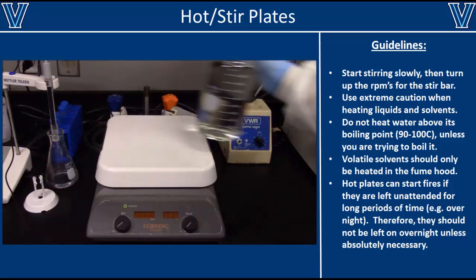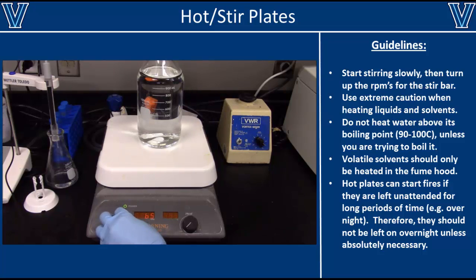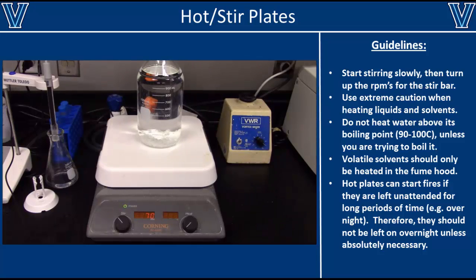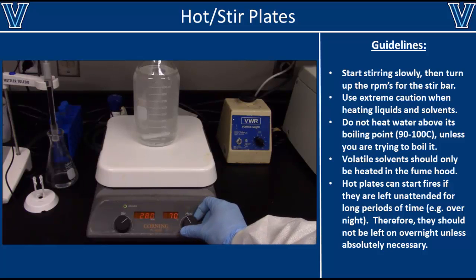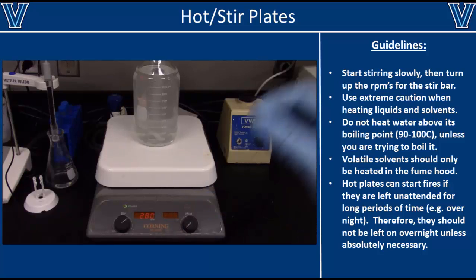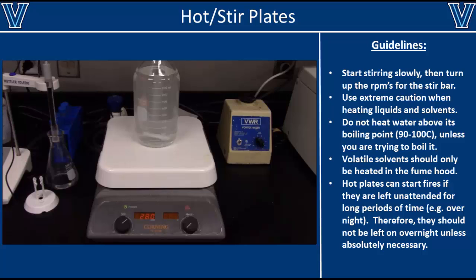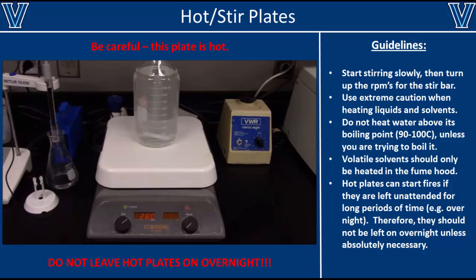Once you have your ultrapure water, you'll probably use a stir plate to make your solution. Begin by inserting a stir bar that isn't too big or too small for the bottle, then slowly turn up the RPMs and add your chemical that you wish to dissolve. In some cases, you may wish to heat the sample as well. Please remember to use extreme caution when heating liquids on a hot plate. For example, do not heat water above its boiling point, which can be 90 to 100 degrees C, unless you are explicitly trying to boil it. Volatile solvents should only be heated in the chemical fume hood to avoid inhalation of any harmful vapors. Finally, hot plates should not be left on at high temperatures for extended periods of time — try not to leave a hot plate on overnight, since it is not uncommon for hot plates to overheat and create a fire hazard when left unattended.